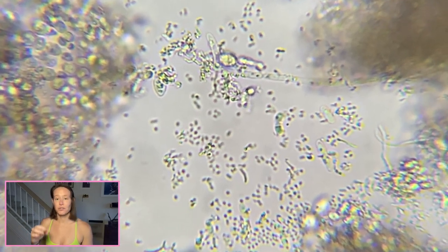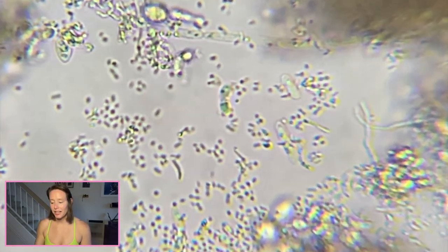We can also see that there's a lot of little clusters of bacteria. For the most part, they look like they are spherical shaped. We can also see that there's some rod-shaped bacteria here and also some bacteria that have very long chains.